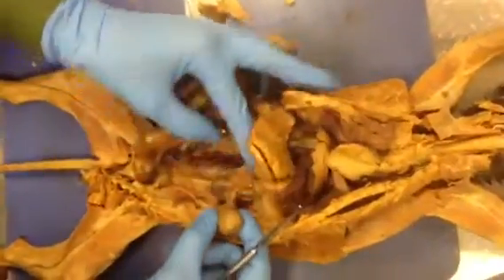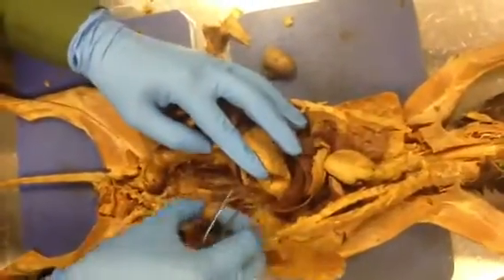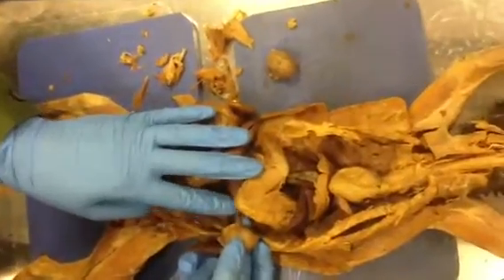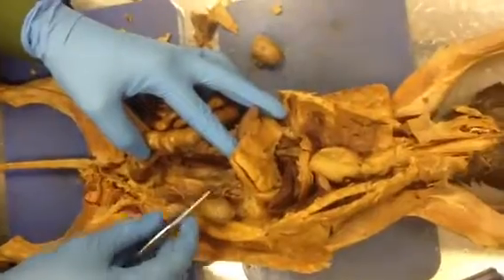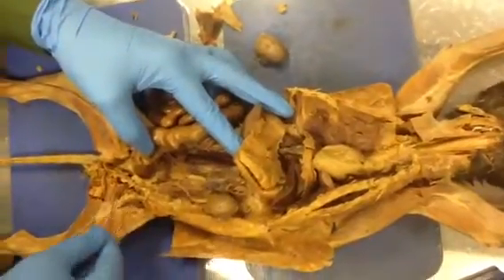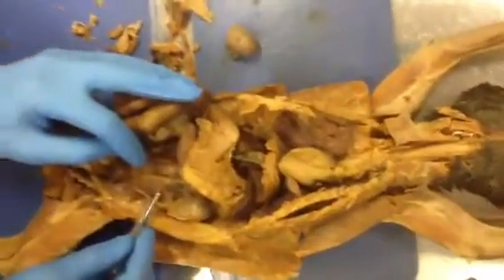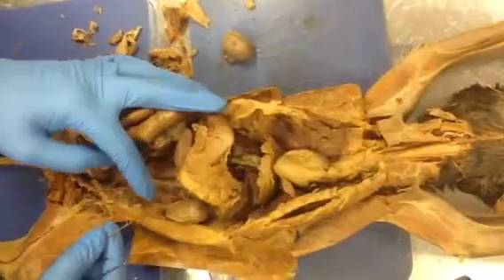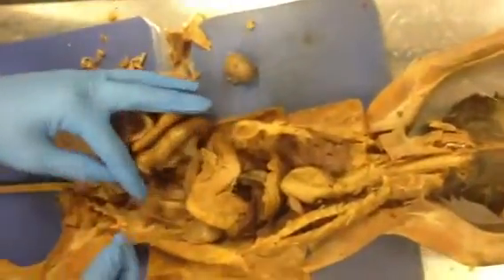Now the blood vessel that is draining here, and you can actually see it. The renal vein is draining the kidney over here, and later on they will clean this up, and you can trace the left gonadal vein, which is actually here. It's not attached, well, partially. So this is the left gonadal vein, which will eventually go to the left testes.